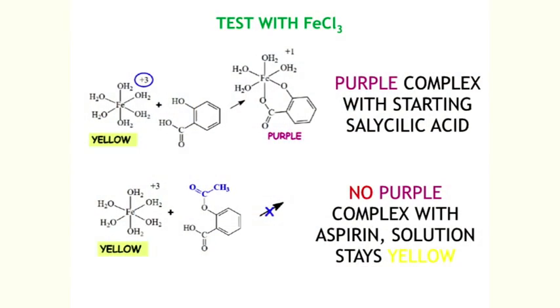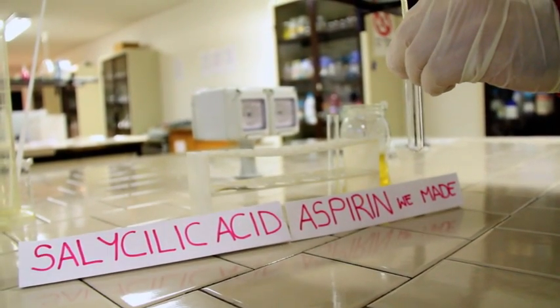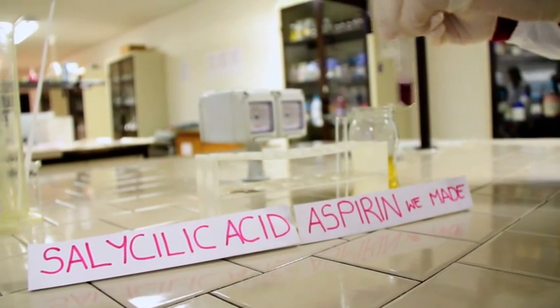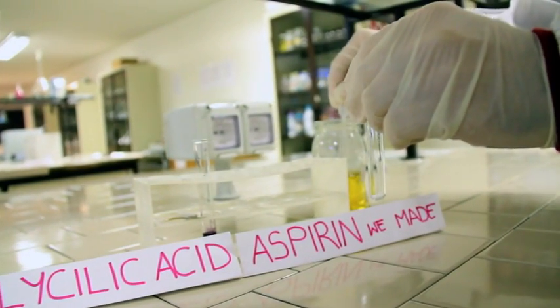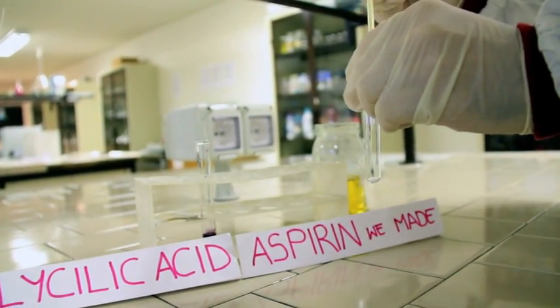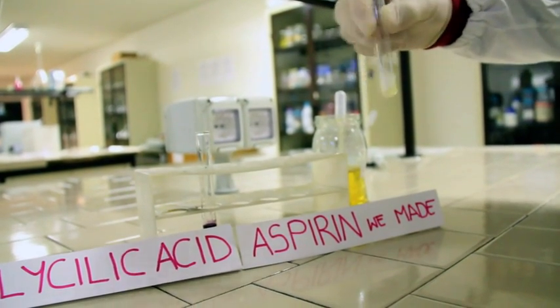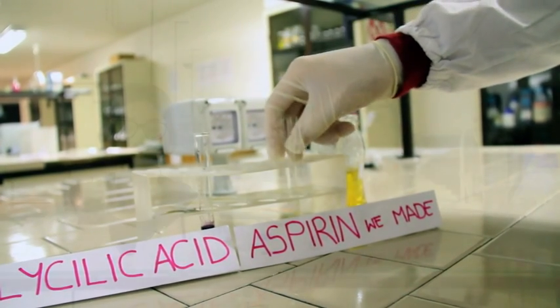How can we be sure that the reaction is complete? We could do the iron chloride test. We add a few drops of iron chloride solution to a sample of salicylic acid and to a sample of the compound we made. As we can see, only the sample with salicylic acid changes color, going from yellow to purple. Our compound remains yellow, meaning that the starting salicylic acid has been completely transformed into aspirin.